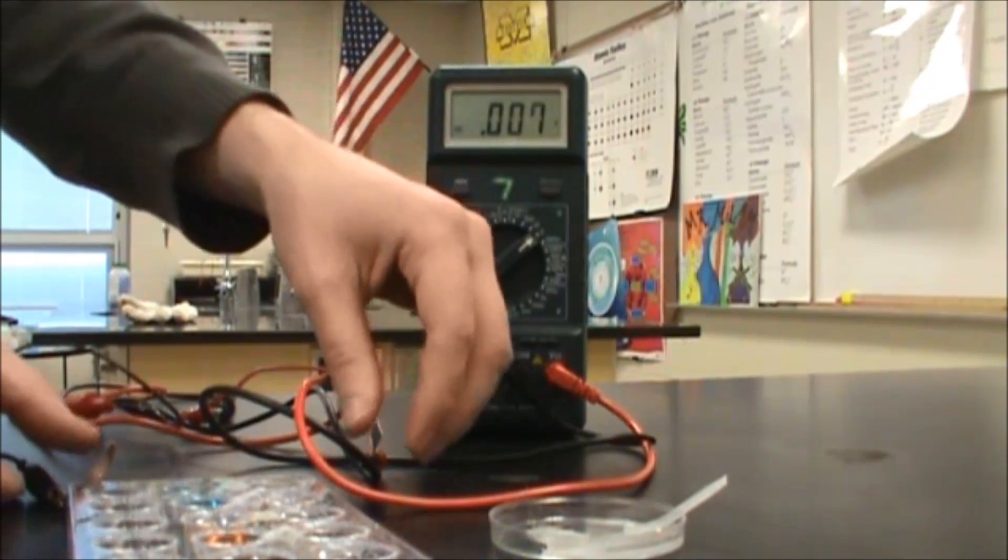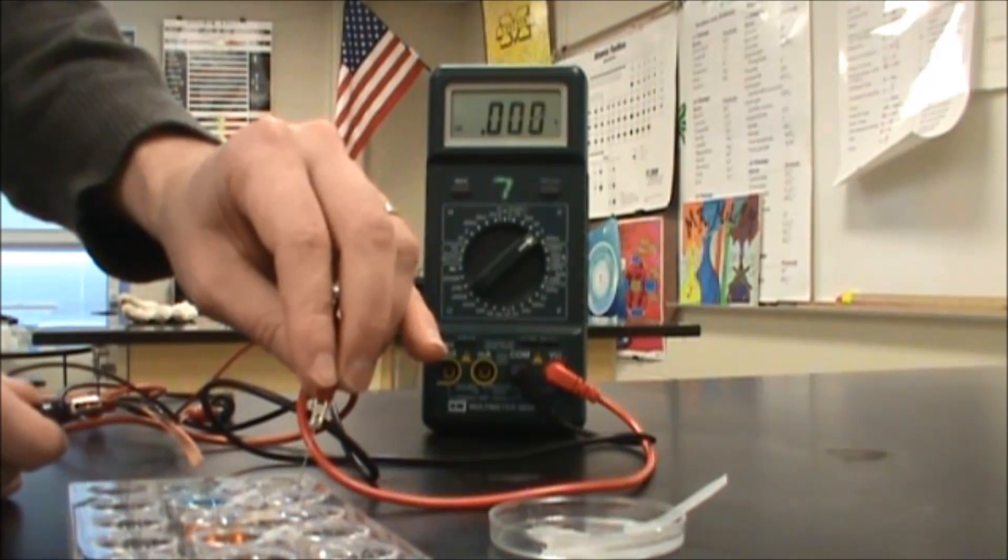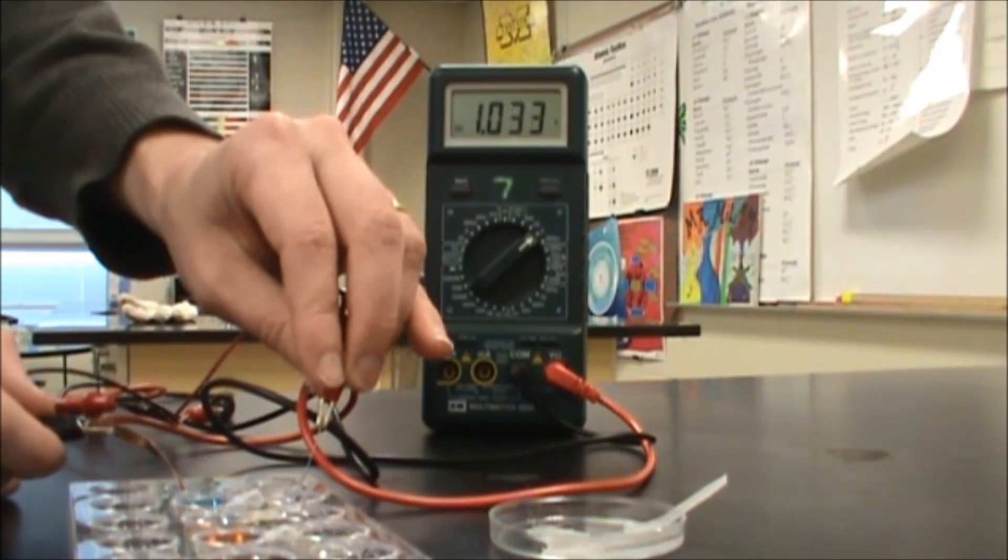So now we're going to go ahead and test the zinc and copper. I'm going to put the zinc electrode into the zinc solution and the copper electrode into the copper.